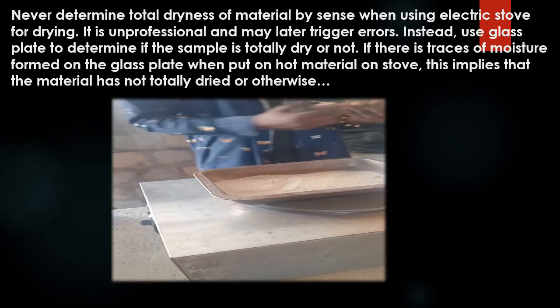Never determine total dryness of material by sense when using an electric stove for drying. It is unprofessional and may later trigger errors. Instead, use a glass plate to determine if the sample is totally dry or not. If traces of moisture form on the glass plate when put on hot material on the stove, this implies that the material has not totally dried, or otherwise.